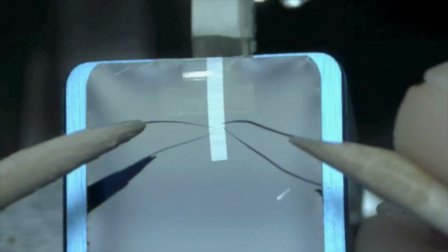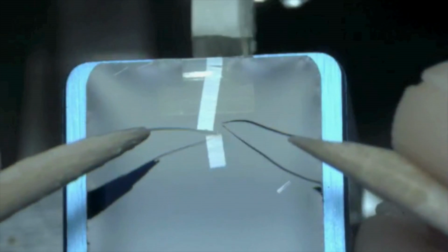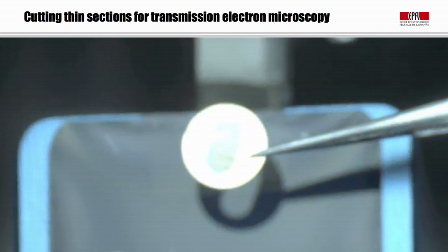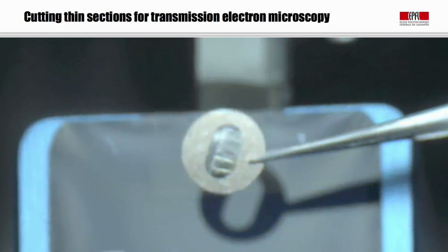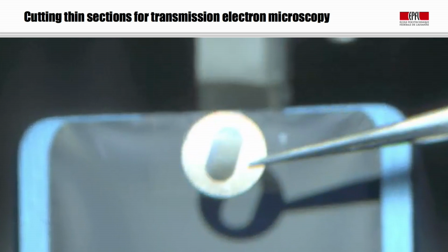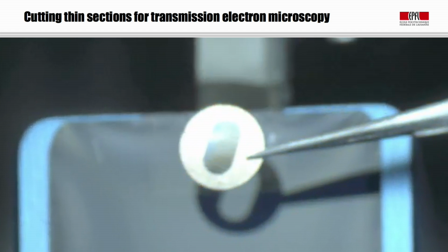We can then take these manipulators, which are simply very fine hairs stuck to wooden sticks, and these are able to manipulate the sections and push the sections toward the microscope grid, or the slot grid, onto which the sections will stick. Now these slot grids are simply an aperture across which there's a very thin membrane of polymer, and the sections will stick onto this aperture. You can just about see the sections here. There's gold-coloured sections sitting across that hole. This is then dried for a few minutes, and then this is now ready either for further staining or for imaging in the electron microscope.